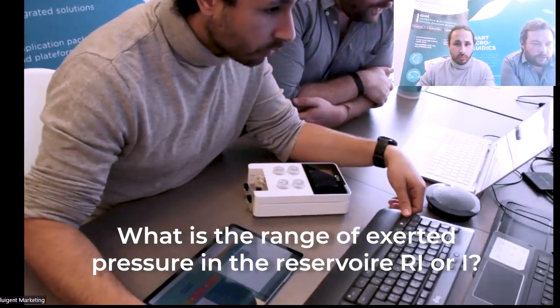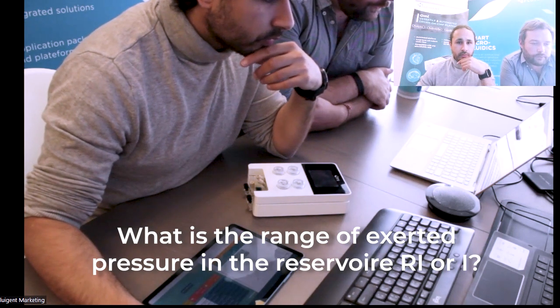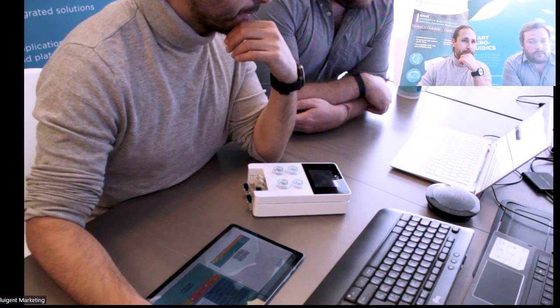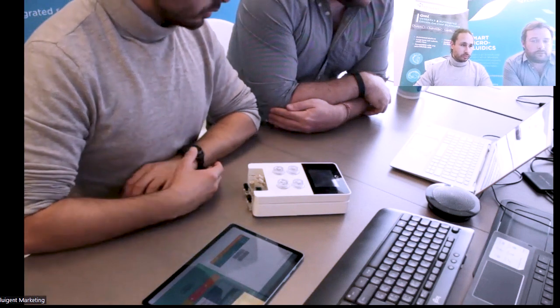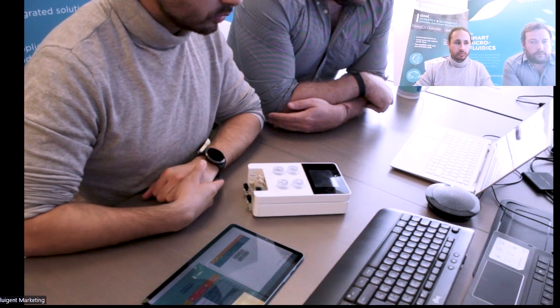So what is the range of exerted pressure in the reservoirs? Is it possible to use a fluid whose viscosity is around 10 millipascal seconds? The maximum pressure is 600 millibar. We don't have a precise idea of what the viscosity should be. Actually, OMI is meant to be used mostly with water-based solutions. Why? It is because of the flow meter that is calibrated for those kinds of solutions.